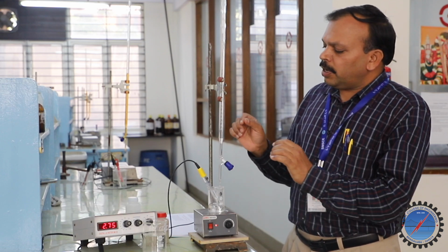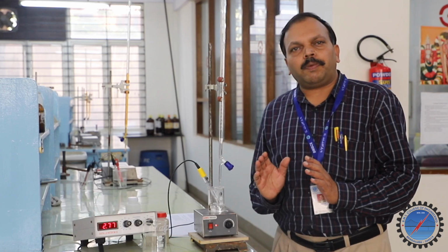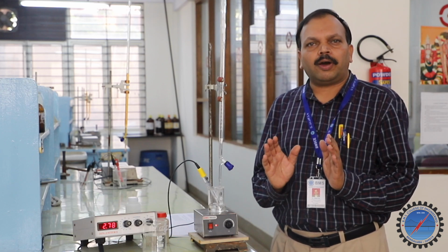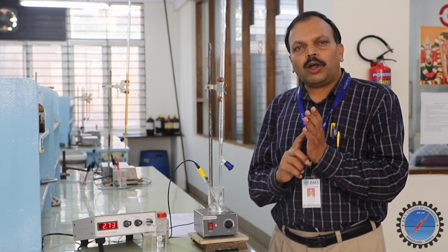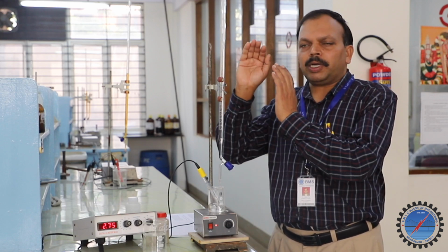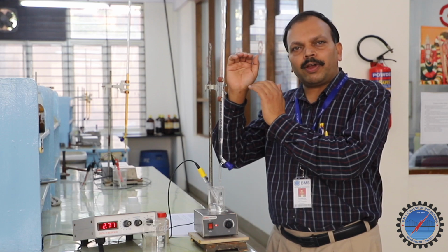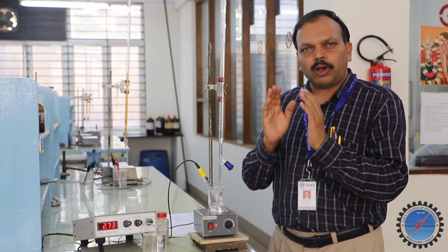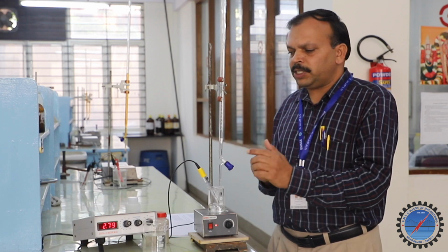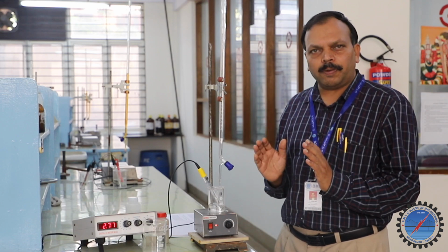Now for this experiment, we are going to tabulate the variation in pH in a tabular column. In the tabular column, the first column is the volume of NaOH, where we keep adding in 0.5 increments, starting from one particular fixed value. That is the first column, volume of NaOH, to note down. The second column is to note down the pH value, the pH variation from the pH meter. We are going to record it as the pH value.